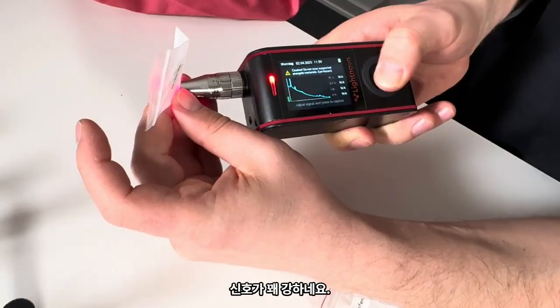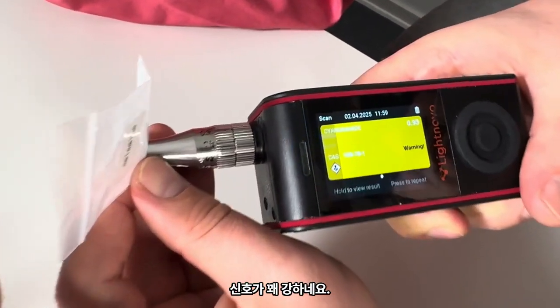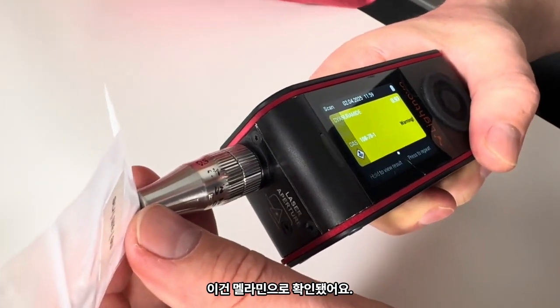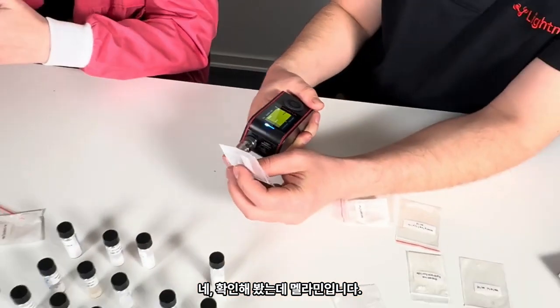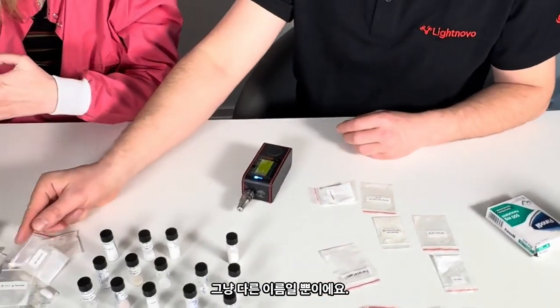Quite strong signal. Okay, it shows us it's cyanuramide. However, Yaroslav, you probably... Yeah, we checked and it's melamine, it's just another name. It's another name of it, yes.